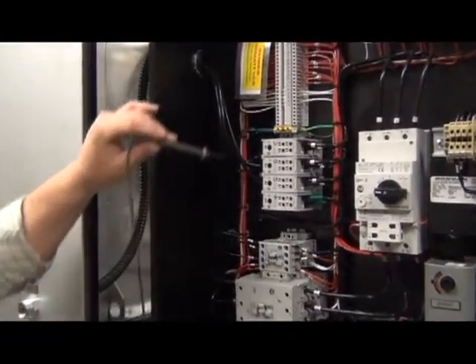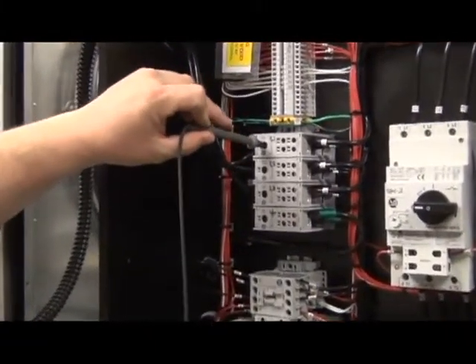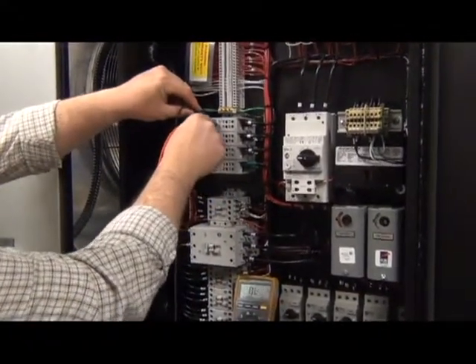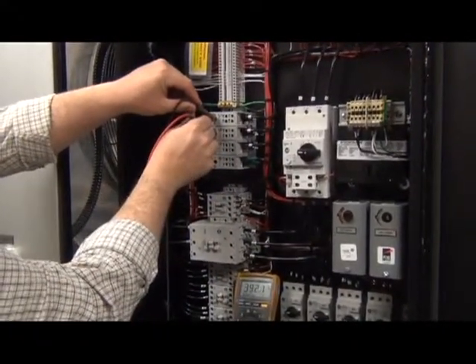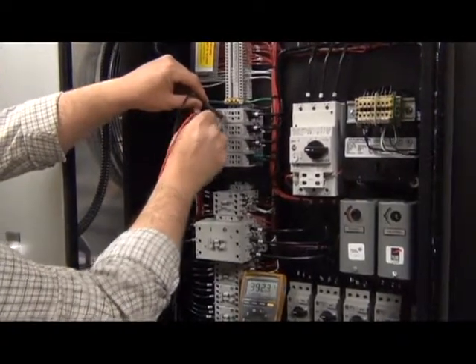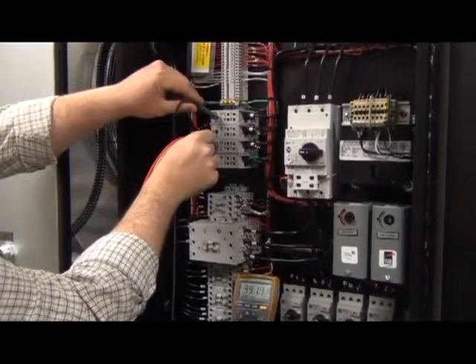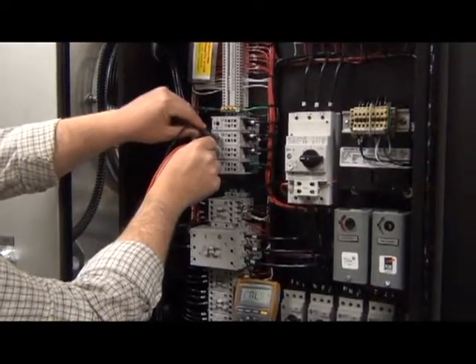Once you've ensured that the phase is correct, then you want to check your line voltage from leg to leg, and make sure that you're getting the proper voltage to each leg. And all three phases.